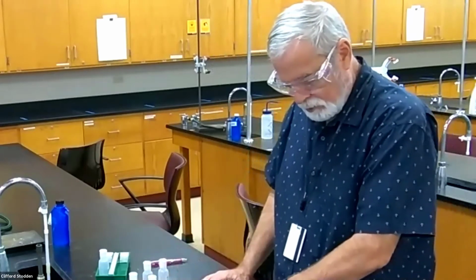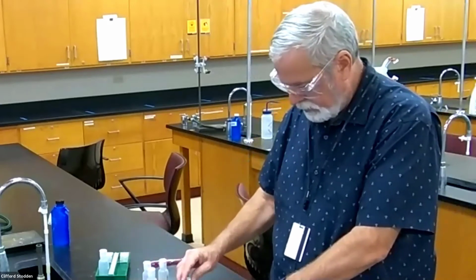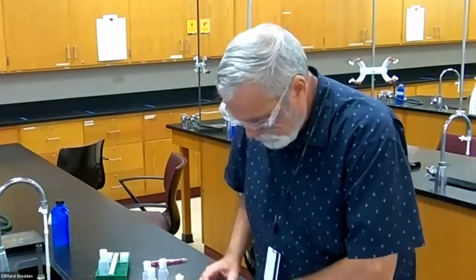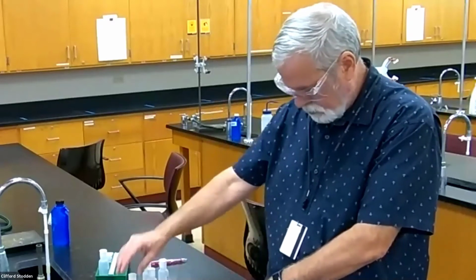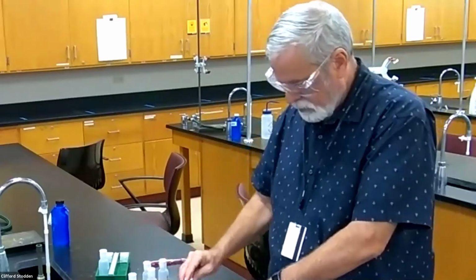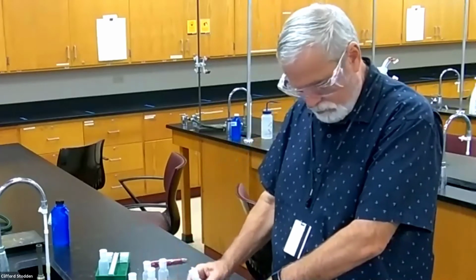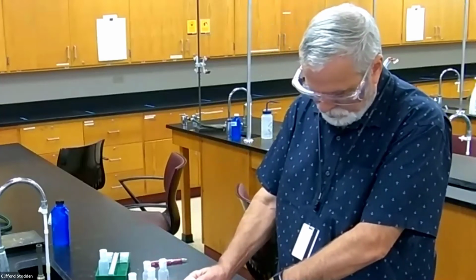Okay, and now I'm up to sulfuric acid. So again, this could be possibly a sulfate that could form a precipitate with the copper. And let's see anything here. Ammonia is the next one, ammonium hydroxide. Okay, now again, ammonia could reduce the copper also, or you could get a precipitate with the hydroxide in the copper. Copper hydroxide could form.